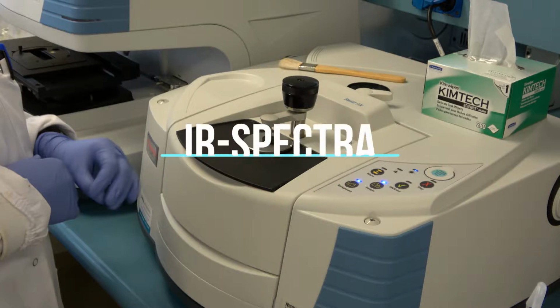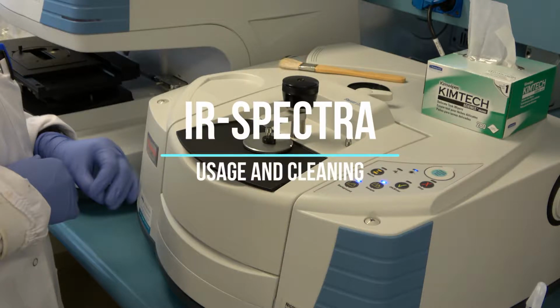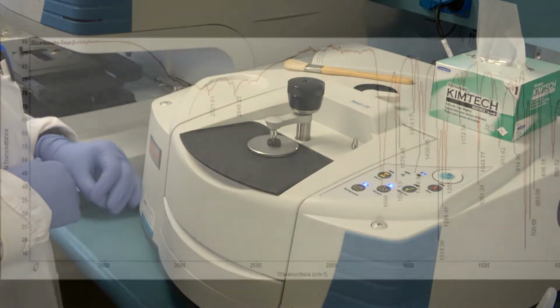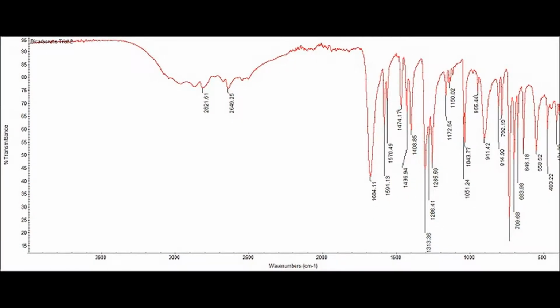IR spectroscopy uses infrared radiation to excite molecules, giving a spectra of the energy absorbed by the molecule. This gives an idea as to what functional groups the compound might contain and can be used with other analytical methods to formulate a molecular structure for the compound.